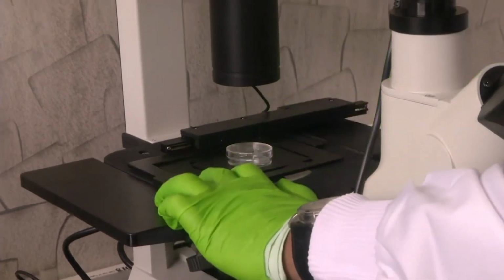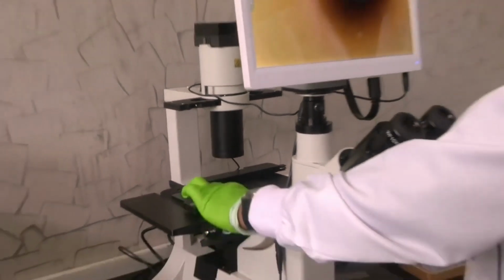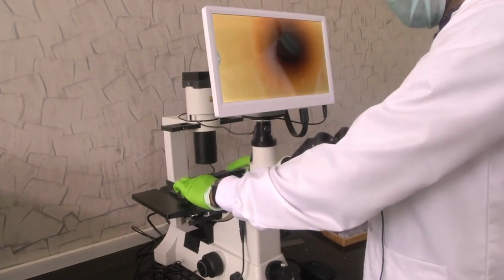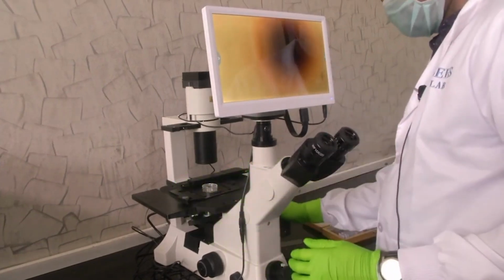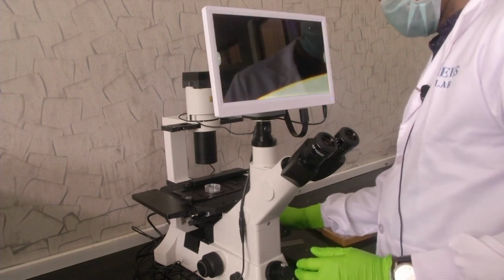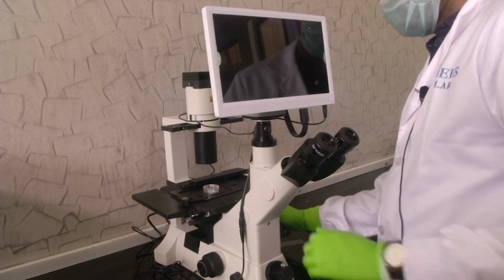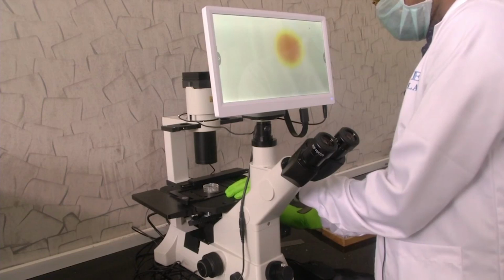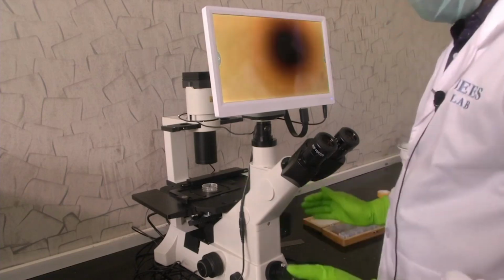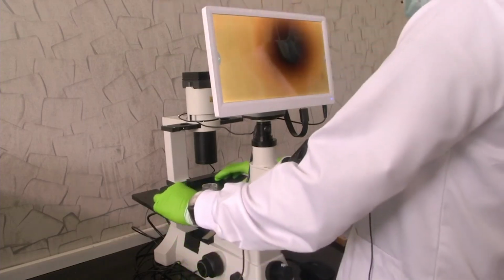Once the sample is held in place, just like in the other microscopes, we have the XY stage adjustment. So, if I move, see, this sample holder is moving. It's moving in the X direction, it's moving in the Y direction. So, this is how the sample can be moved around. So, these are the details about the sample holder.